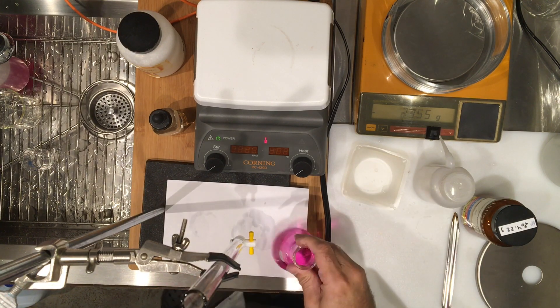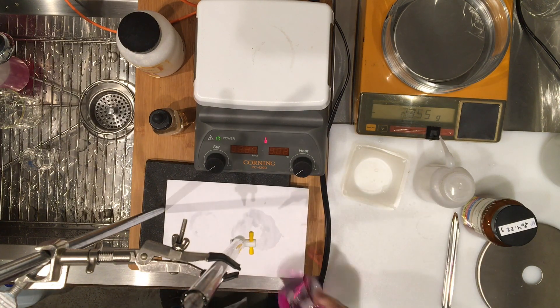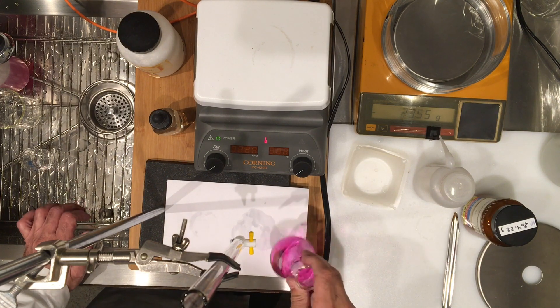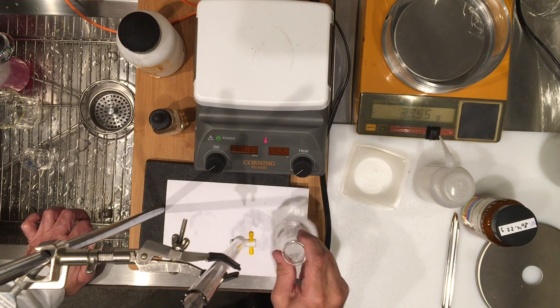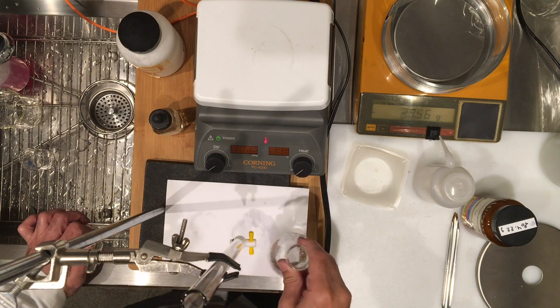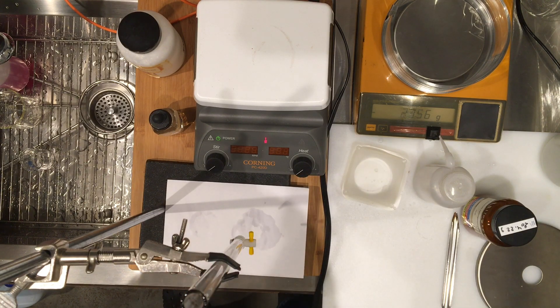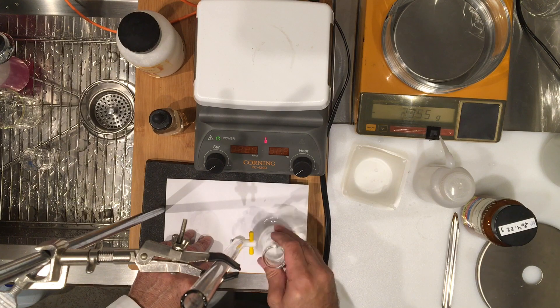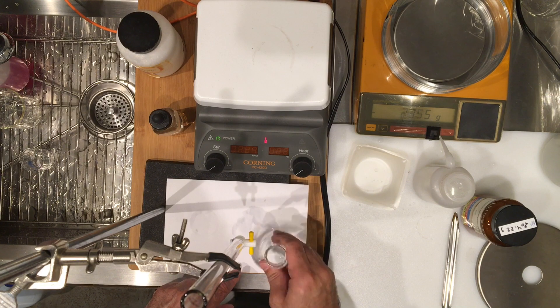The reason you're seeing the pink is because I didn't let the KHP dissolve. I can still see KHP because it was surprising to me that after adding roughly 20.7 mL, the color was not changing — there it is, it's changing now. So we are very close, but again it's very important to have the entire KHP dissolved, and I didn't give it enough time. In fact, I don't remember even swirling it to dissolve it.